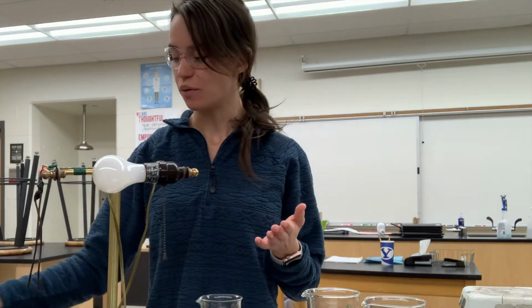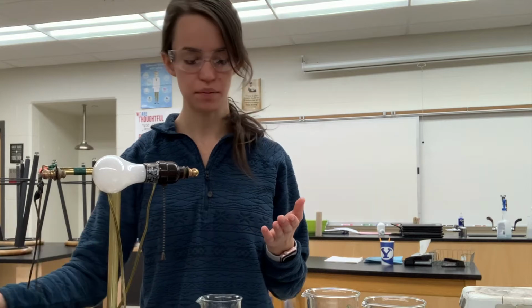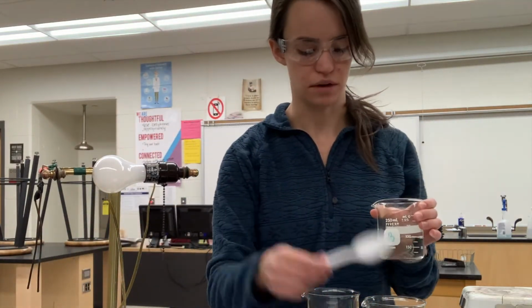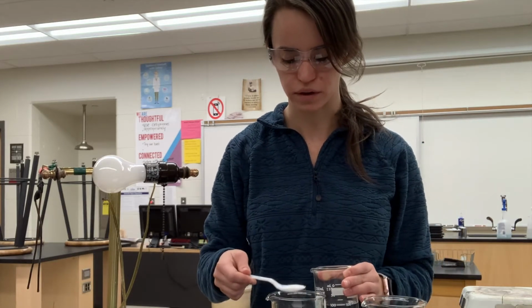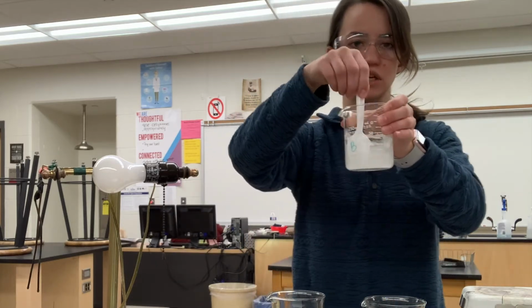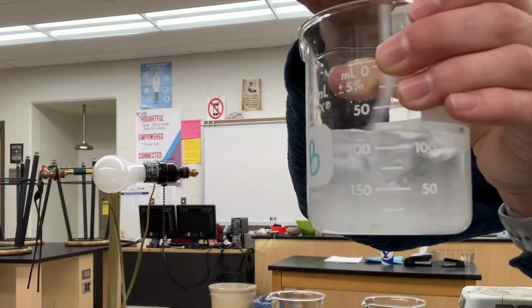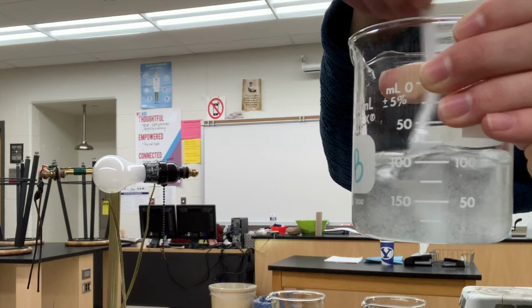All right, we're gonna clean off these prongs so we can try it with our substance B and see if that makes it light up. Again, I'm gonna take 100 milliliters and I'm gonna take substance B. I'm gonna throw half of a spoonful in there and then mix it. Again, I'll show you what it's looking like so you can decide if it's soluble or not. Again, we're gonna do this for about 20 to 30 seconds. Try to mix it up really well.